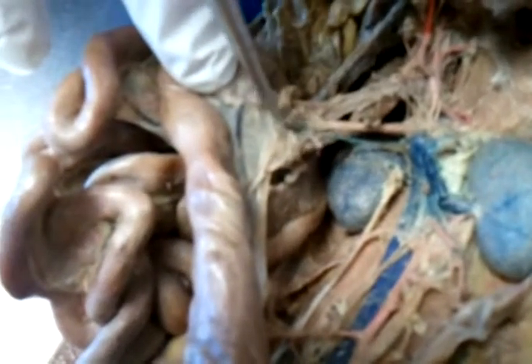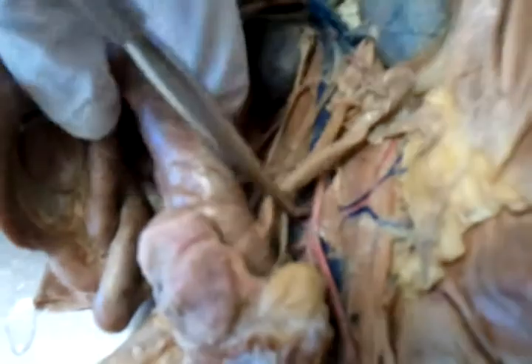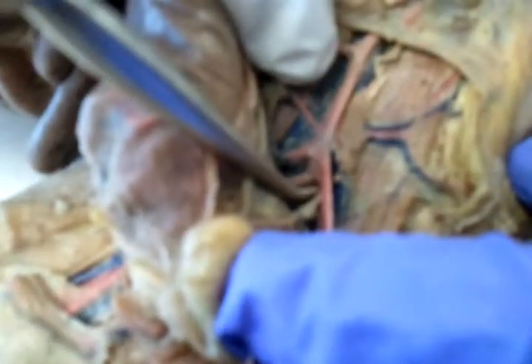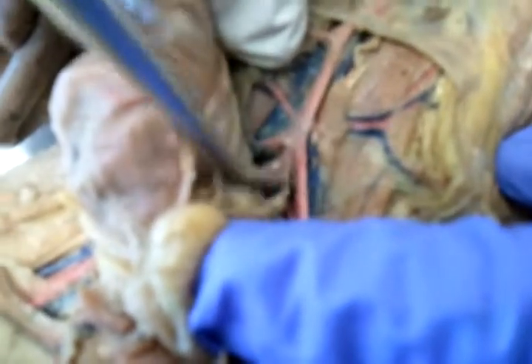The artery is here and the vein is here. Going down, this main cross section is the ilio-lumbar artery and vein. Down here is the inferior mesenteric artery and vein, connected to the large intestine at the bottom. Further down, the internal iliac artery and vein are on the inside, the external artery and vein are on the outside, and then down here is the femoral artery and vein.